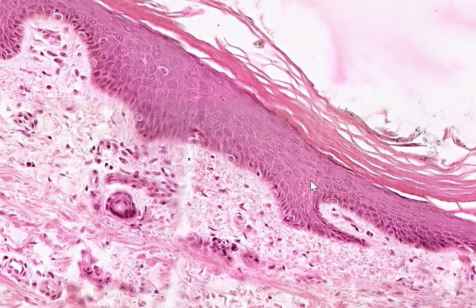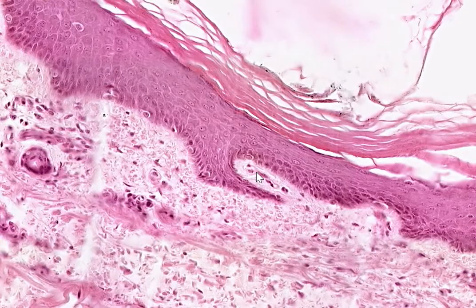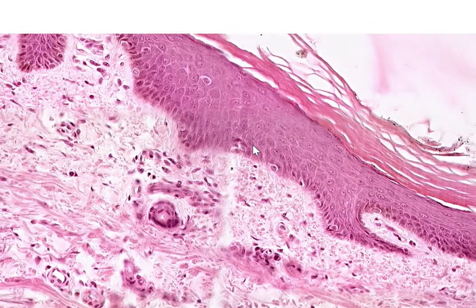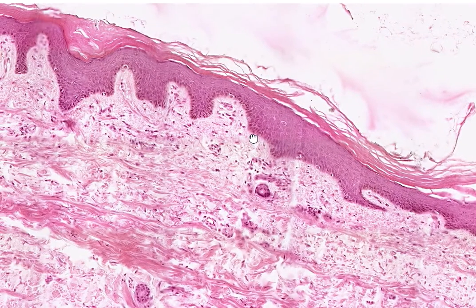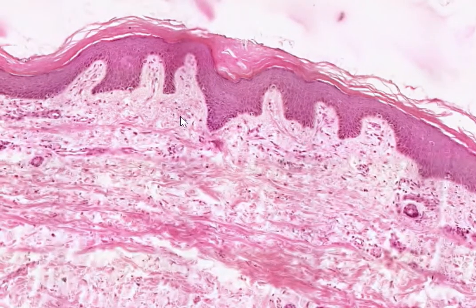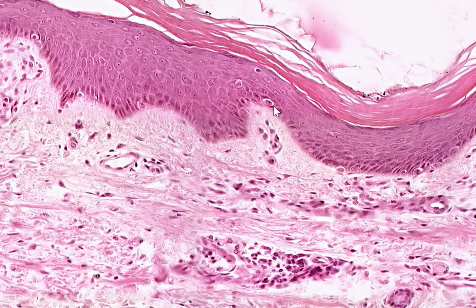This is, of course, not how the tissue looks like when it comes out of the skin, but we process tissue in different ways, so it looks like this. And there are certain changes that can occur to the cell that will lead to the fact that it looks like this, all pink and purple when it comes out.